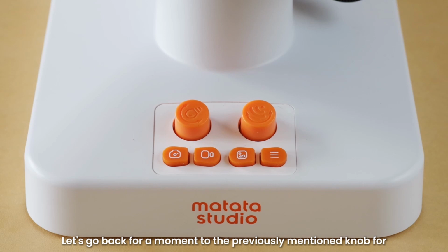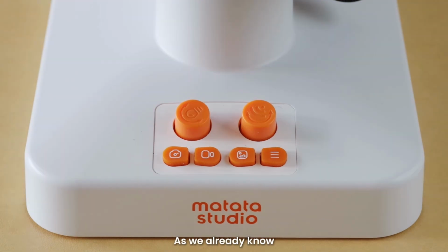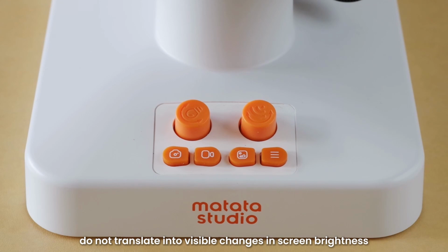Let's go back for a moment to the previously mentioned knob for changing the brightness of the light source located on the left. As we already know, changes in the intensity of the light source don't translate into visible changes in screen brightness. We can therefore ask, what role this knob plays?